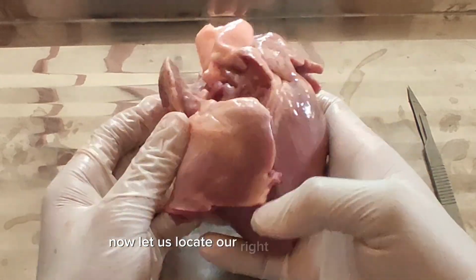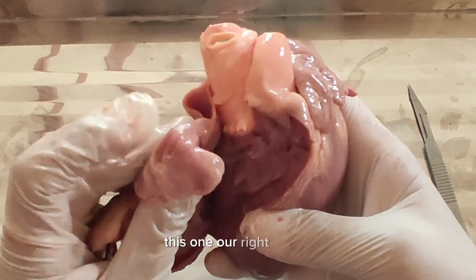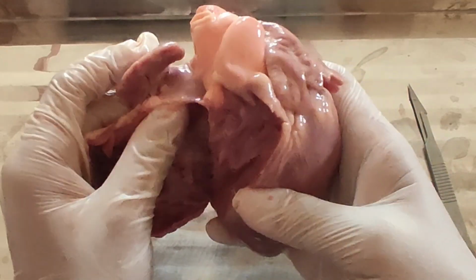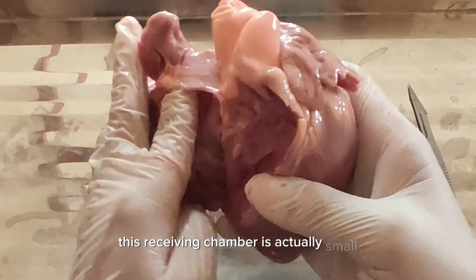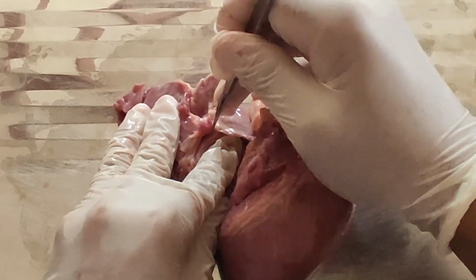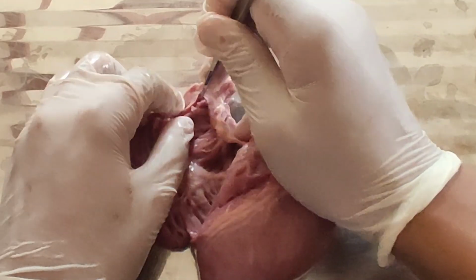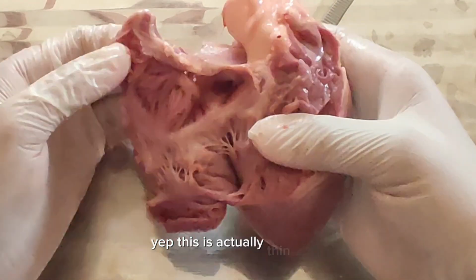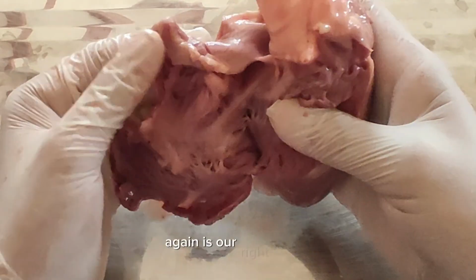Now let us locate our right atrium. Still here, still intact. Our right atrium right here. This is our right atrium. And then notice the thinner muscular wall of this receiving chamber. Actually small. Let's cut right into it, everyone. Right atrium. Yep, this is actually thin walls. It is actually thin walls that cover the right atrium. Again, this is our right atrium.